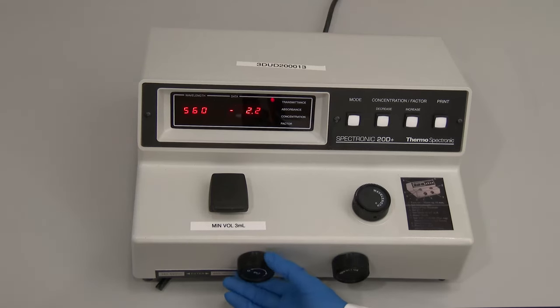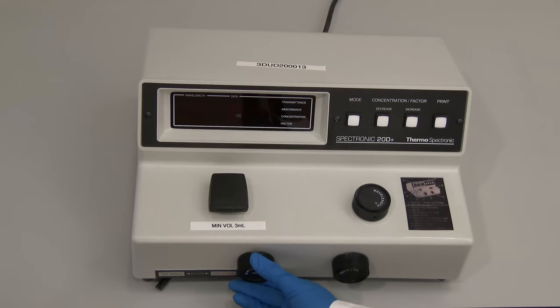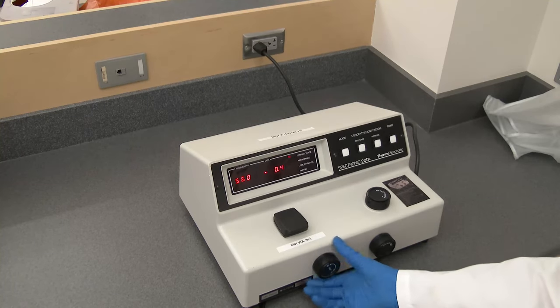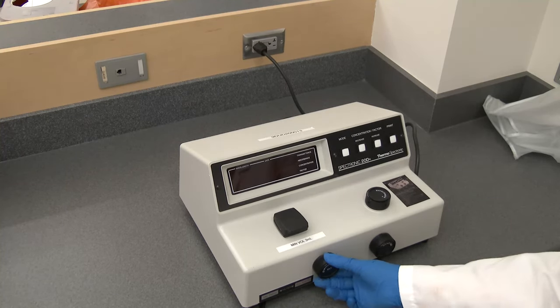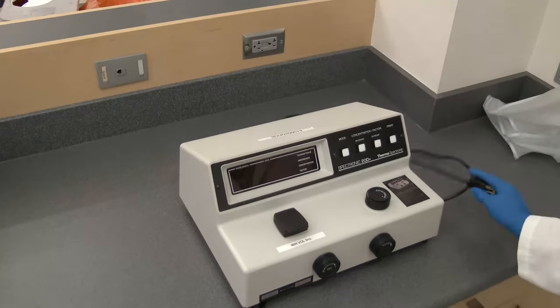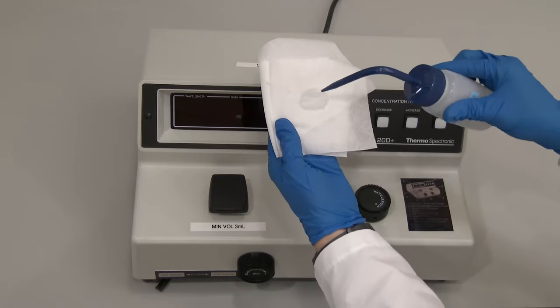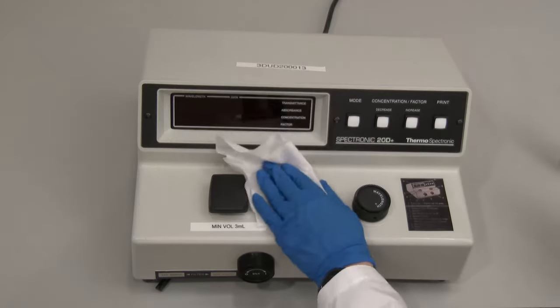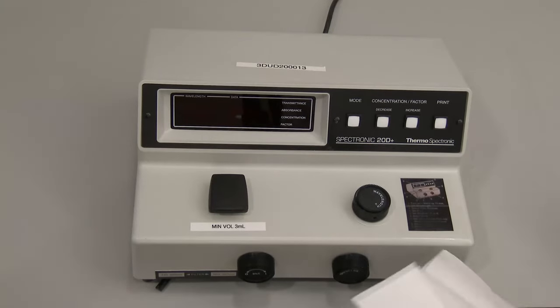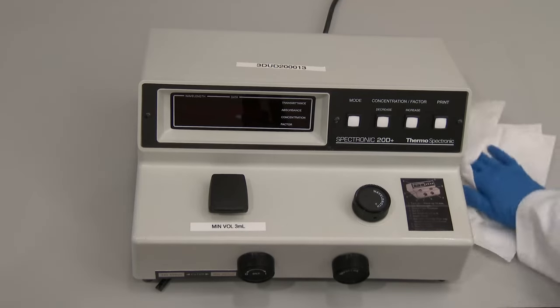Once all measurements are complete, power off the spectrophotometer by turning the power switch zero control knob percentage T counterclockwise until the instrument clicks and the display is blank. Carefully unplug the power cord from the outlet. Clean up any spills on the instrument using a lint-free tissue dampened with water or ethanol, followed by a paper towel dampened with plain water, or clean around the instrument with a bench cleaning solution. Completely dry the exterior of the instrument with a lint-free wipe. The spectrophotometer should be covered and placed in a secure area for storage.